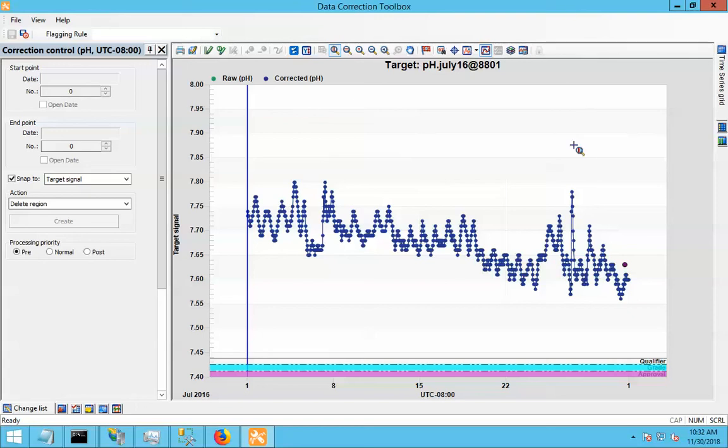Okay, let's look at USGS multipoint corrections. Say I've had my sensor in the water for a while, and I've collected this much data. Near the end of that period, you see I've got my reading here, where I cleaned the sensor and saw what it was reading, and discovered that this data was reading a little bit too low. So we're going to have to correct for that.